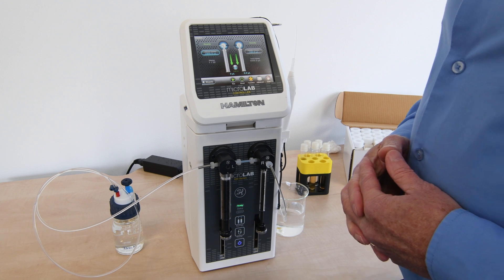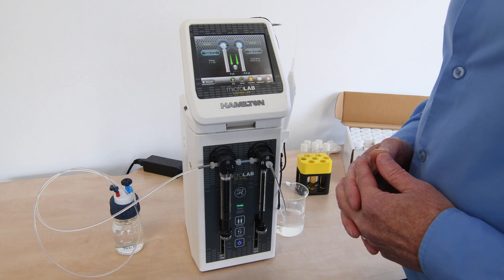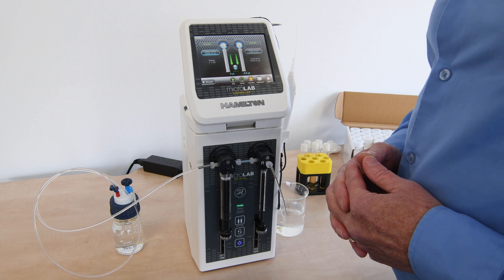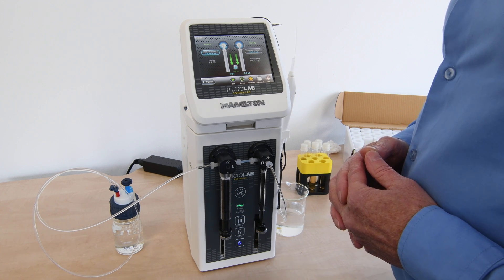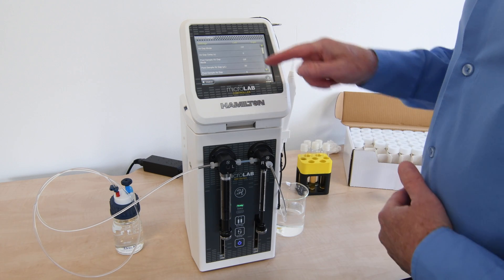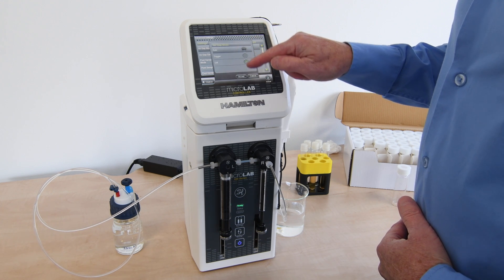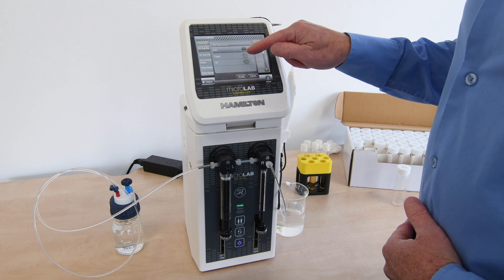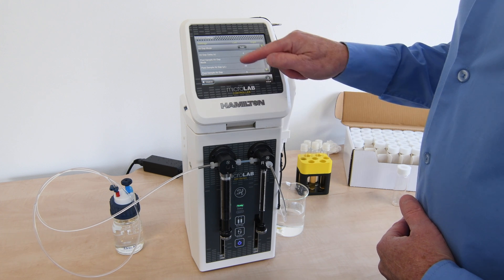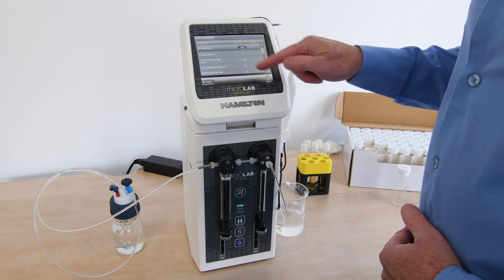Now we've seen the standard dilution format in default mode, giving both the sample and diluent volume. We can introduce some other parameters to improve performance using certain types of samples and reagents. In advanced settings, we can actually introduce an air gap. The air gap option can be selected here — the first option is auto and trigger, and I'm going to select auto.